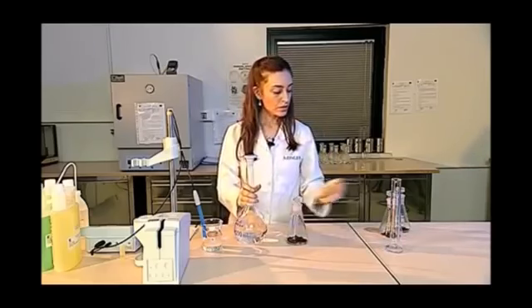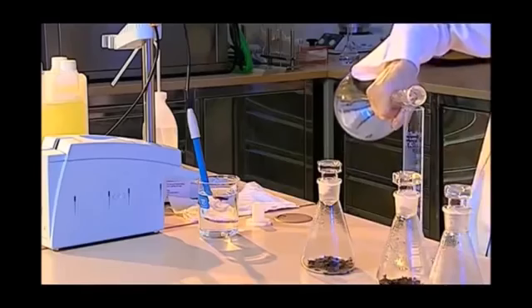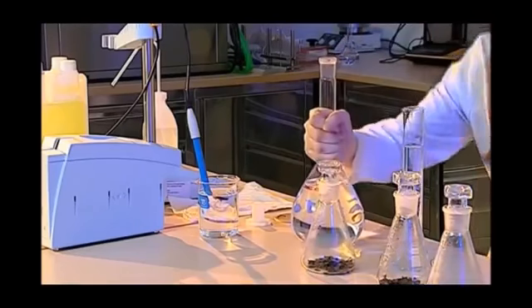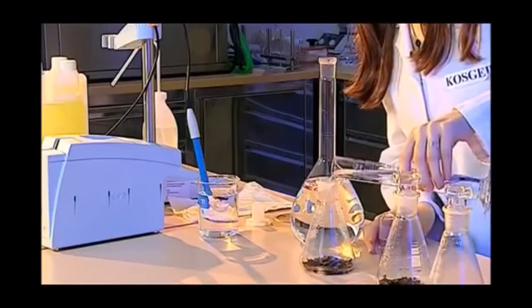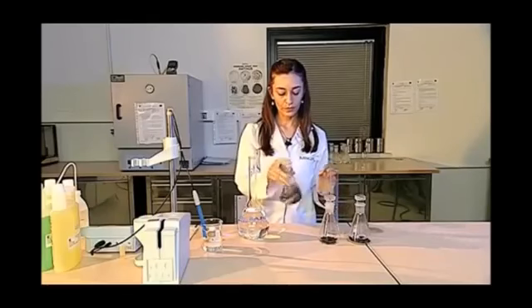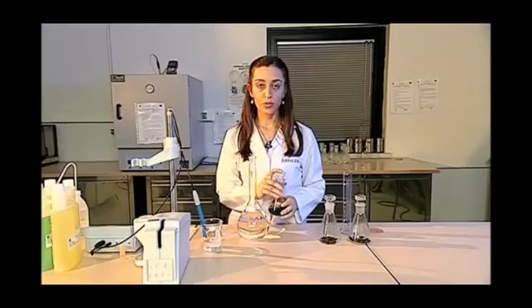In the next step, I apply the solution that I have prepared to the samples. For this, I apply 100 milliliters to each sample. I make sure that in colorless liquids, the lower surface of the liquid is in the line. In this way, I apply the solution. The next thing to do is to place the prepared sample inside the mechanical beater and leave it exposed to the churning process for 2 hours.